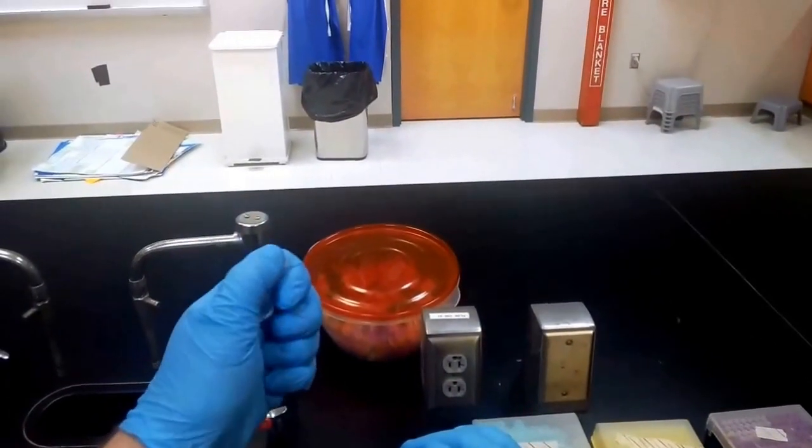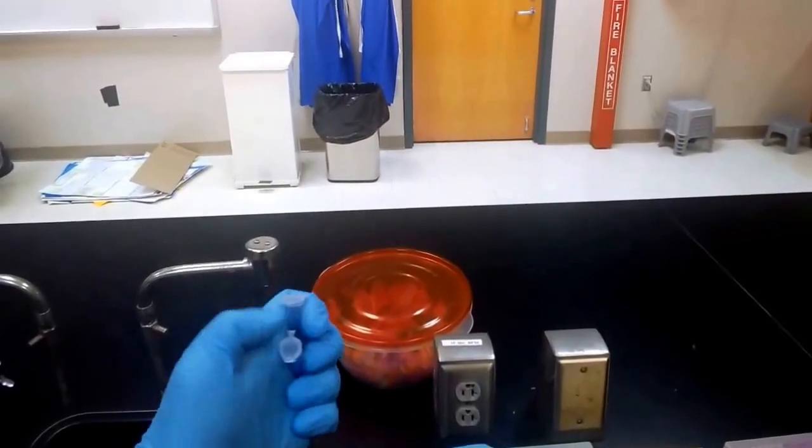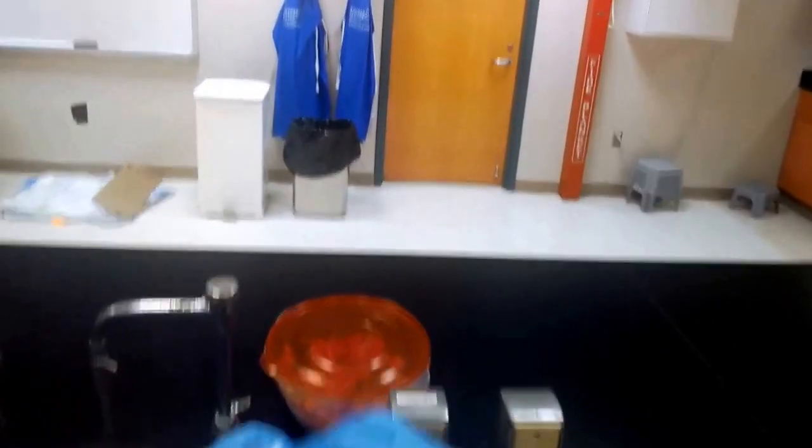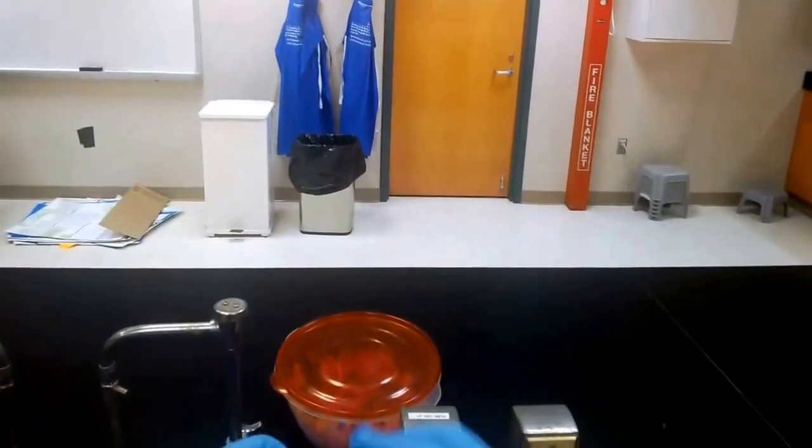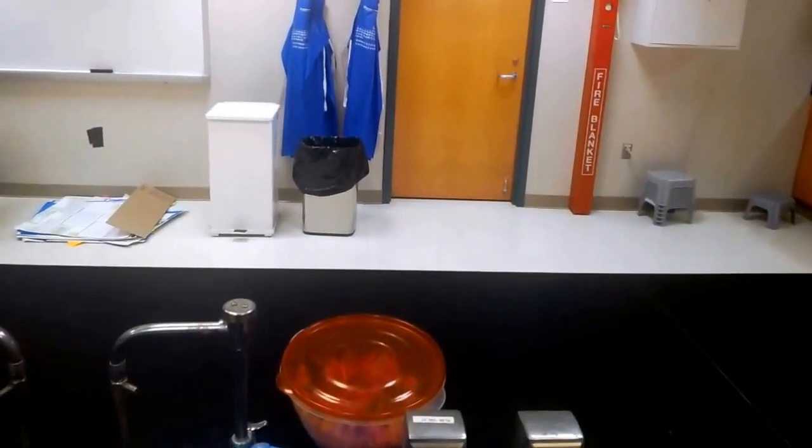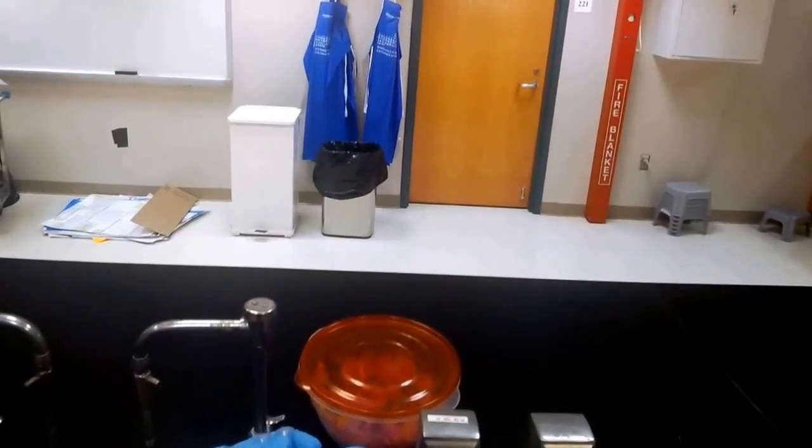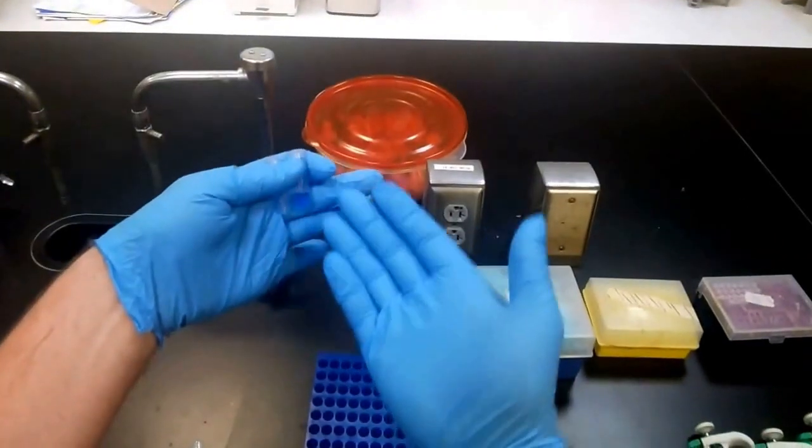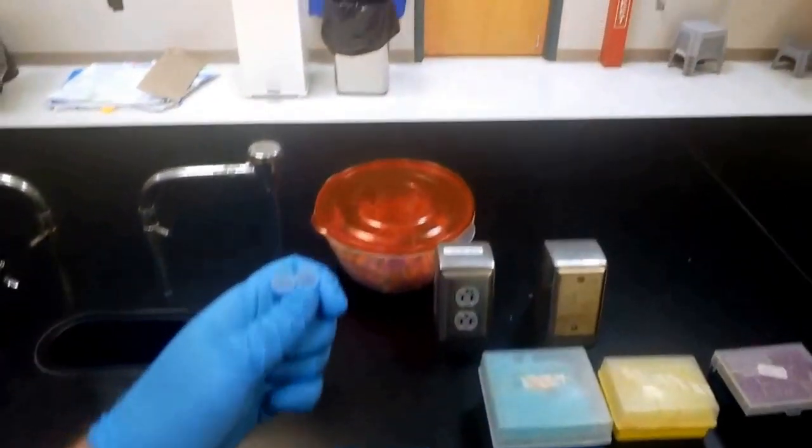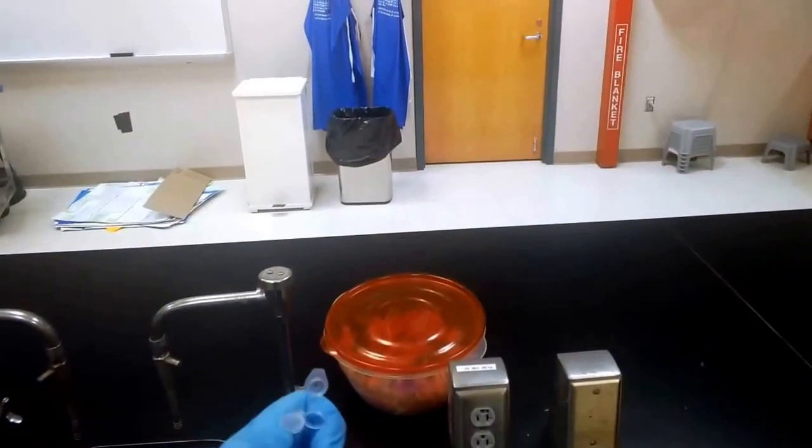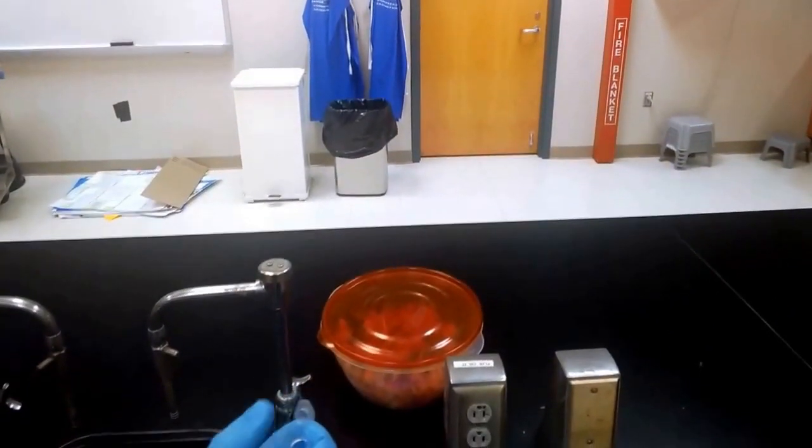Open and close, and it's also useful to be able to do two of them in one hand. This is because you are pipetting from one microcentrifuge tube to another, so we'll try to open and close two of them with one hand.